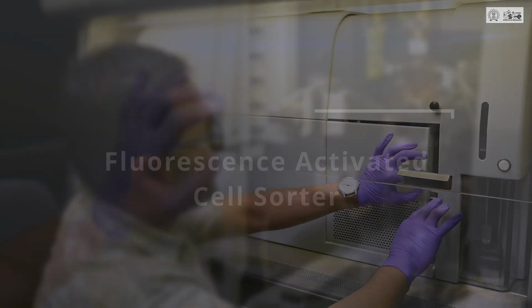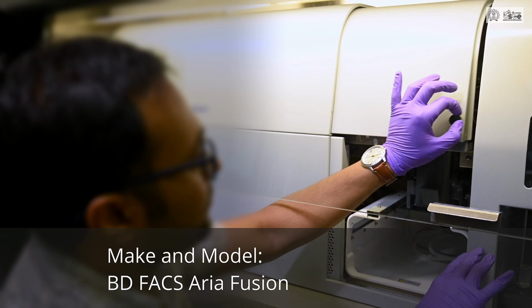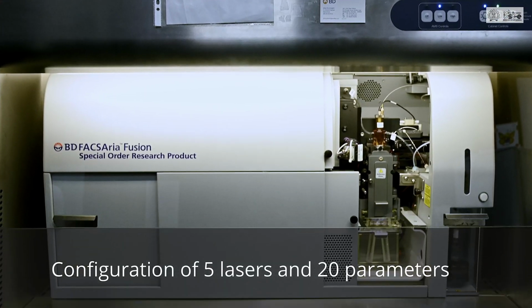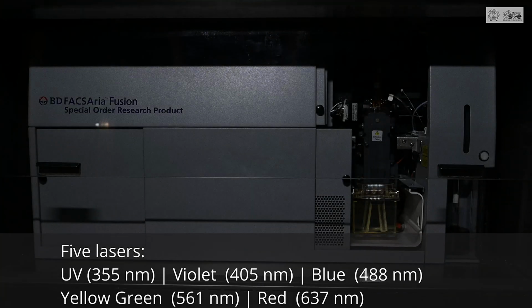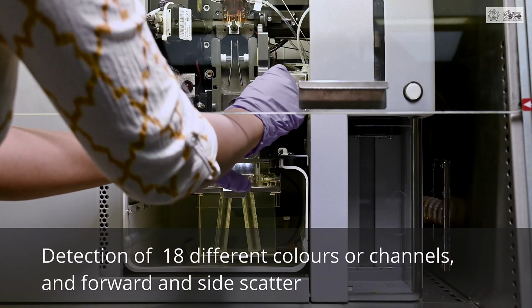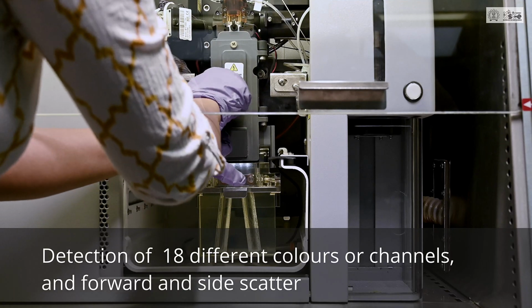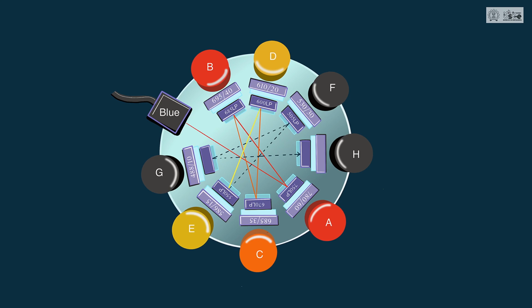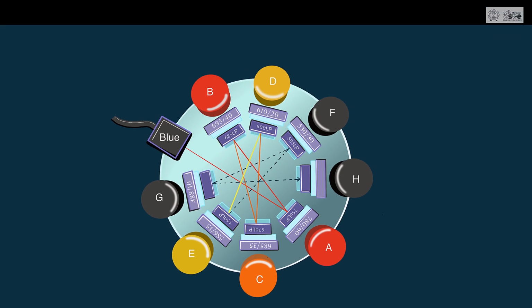The fluorescence activated cell sorter at IIT Bombay can be used for applications such as cell apoptosis analysis, cell proliferation assay and cell cycle analysis, protein engineering, and isolation of immune cells for immunotherapy and immunophenotyping studies, etc. The detectors are designed in an octagonal pathway in order to minimize signal loss.